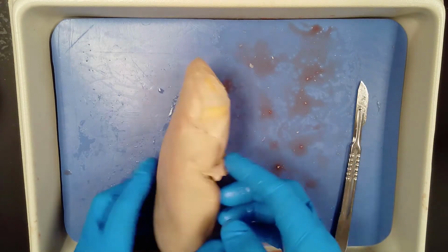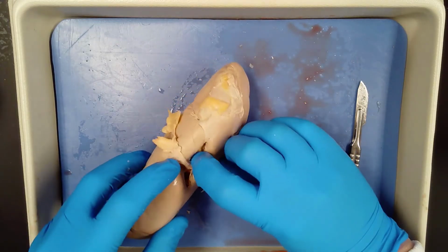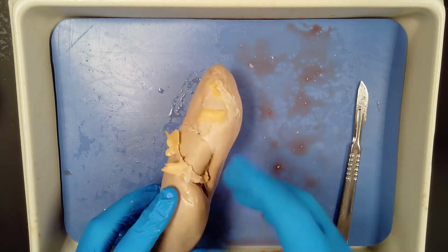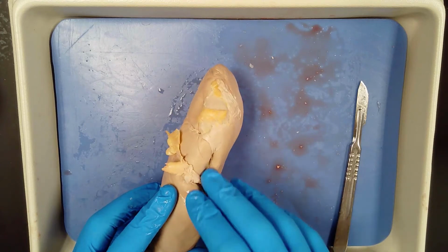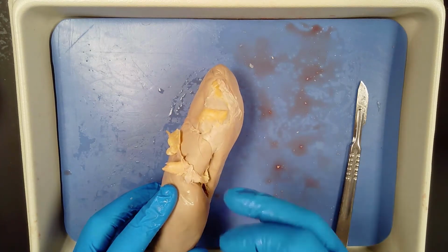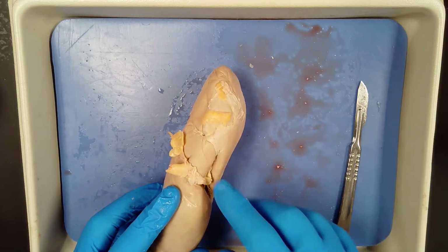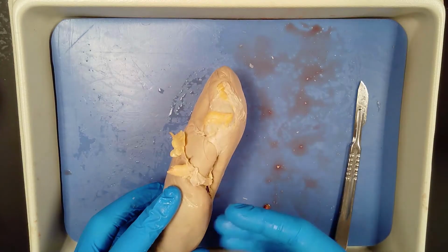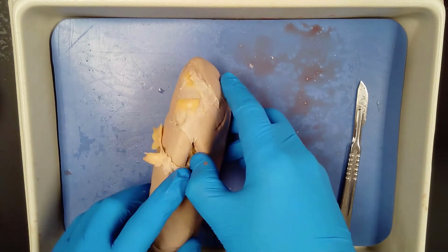What you would be able to see if we could see structures in here really well, and I don't see that we can, but you would notice that the renal artery has a thicker wall. And so that's an easy way to tell the difference between the artery and the vein. And it has a thicker wall because it contains lots of smooth muscle to move that blood. The renal vein has a thinner wall. It's a little flimsier, but again, you can't really see too well on this preserved specimen.